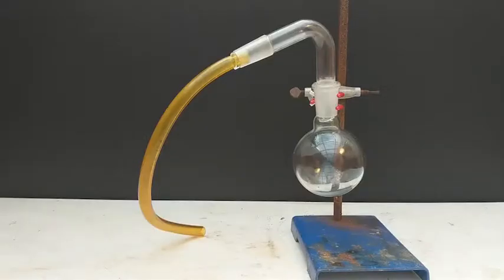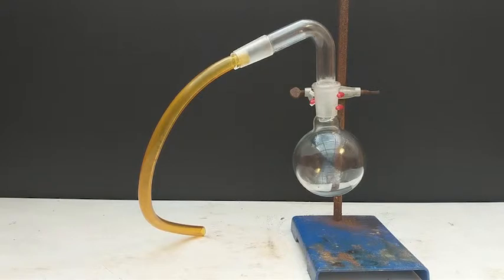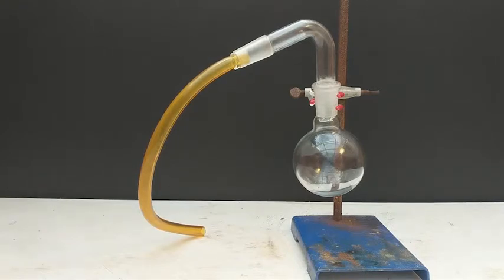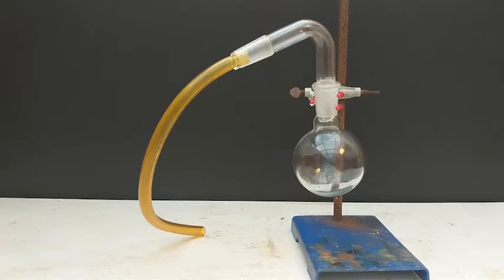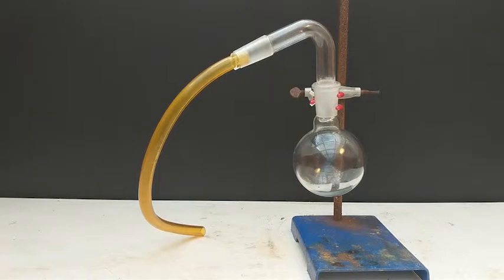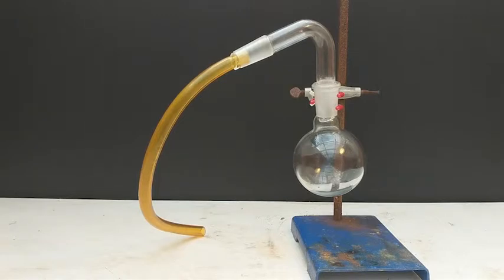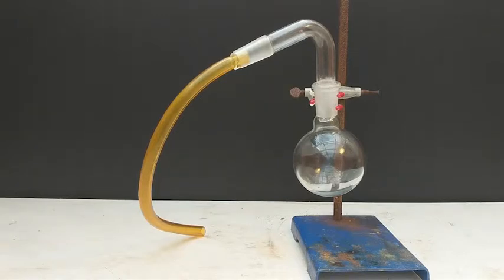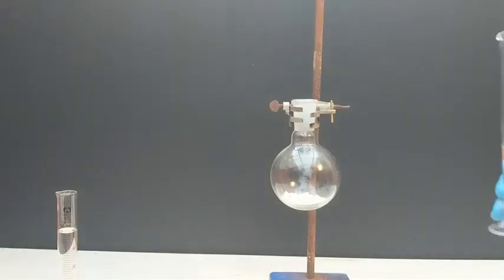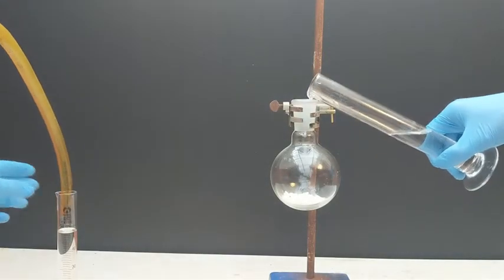Now it is time to set up the apparatus. Once the ammonium hydroxide is added, we must work quickly to assemble the tube to get proper bubbling. However, we were too hasty and one of our lab technicians accidentally poured in all of the ammonium hydroxide at once.